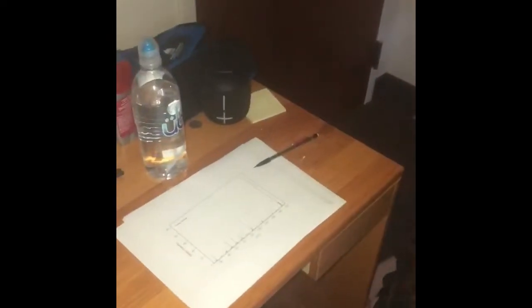Hello, I'm Savannah, and I will be showing you how to look at mass spec, IR, proton NMR, and carbon NMRs to analyze caffeine and see how these graphs reflect the structure of the molecule.